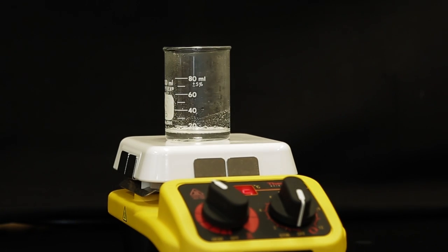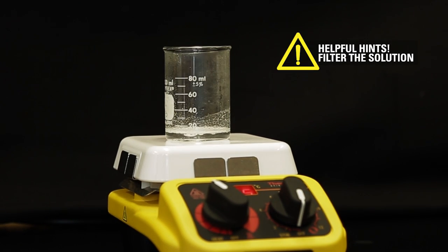Some material may not dissolve when heated. It is always a good idea to filter the solution to remove any insoluble material.